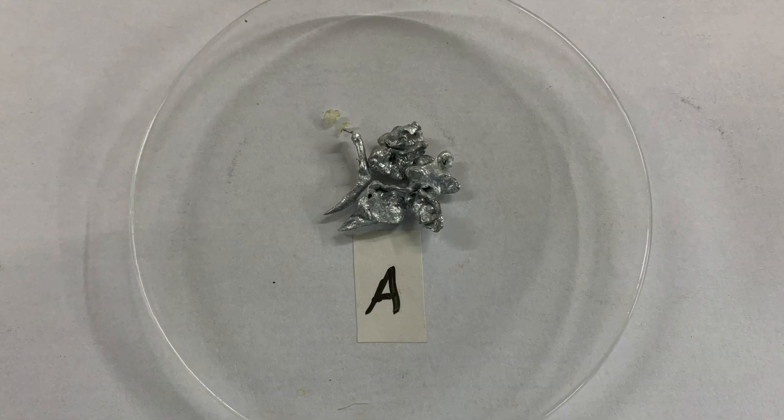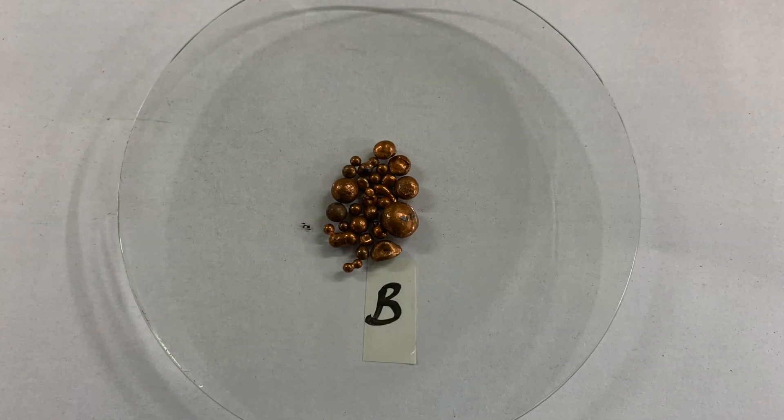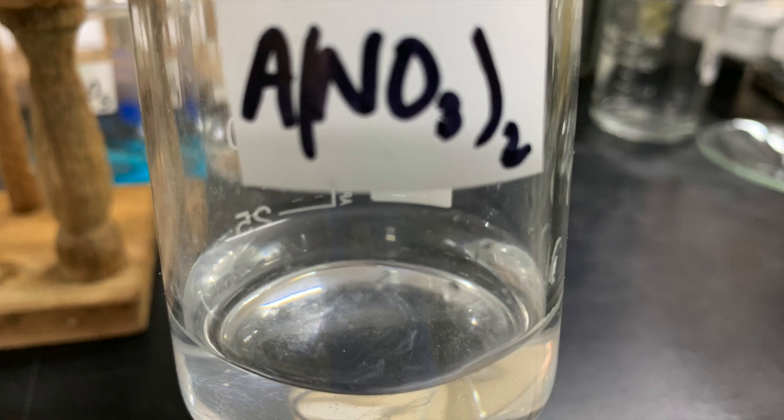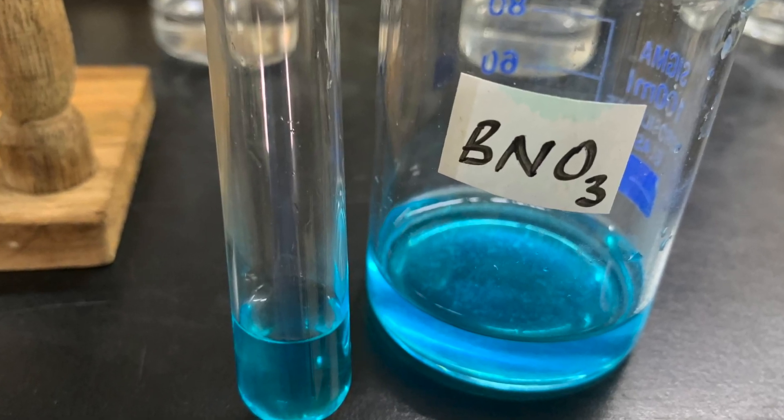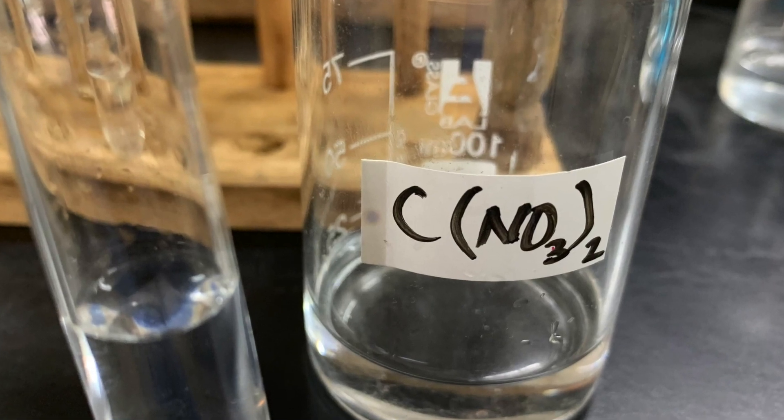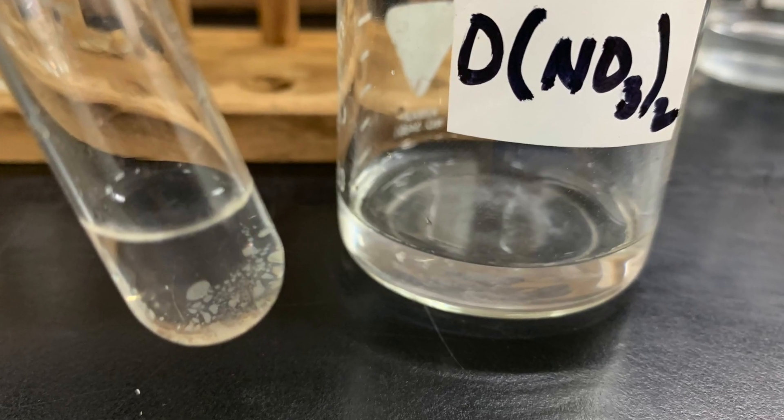This is what we'll do today. We will be determining which of the four elements given is better at reducing another element from the compound that it forms in aqueous medium. We will use two metals — metals A and B — and four nitrates: the nitrates of A, B, C and D, or you could just say A nitrate, B nitrate, C nitrate, D nitrate.